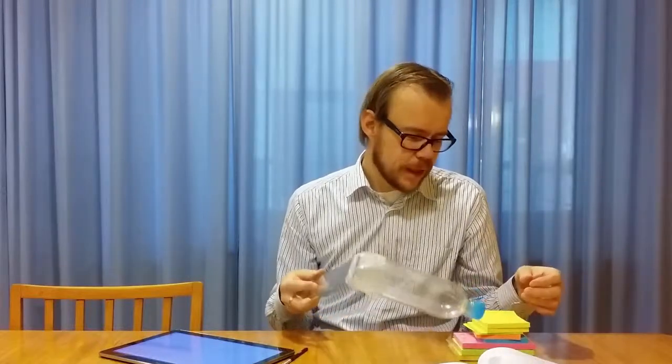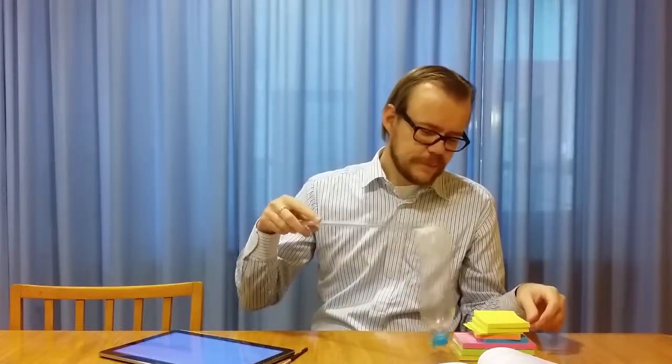And then if I scan the same image again, I will push it a little bit further. And then the position of the particle has changed in the image. And this, of course, you can take advantage of. This is the technique that you use when you move around atoms. There have been studies that did that. But this can be a problem, right? If these particles are pushed around with the probe, you destroy your sample by doing that.